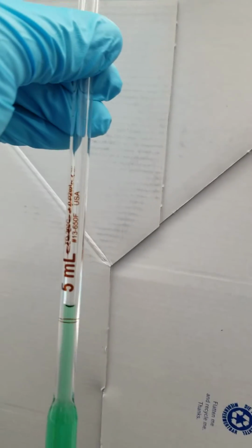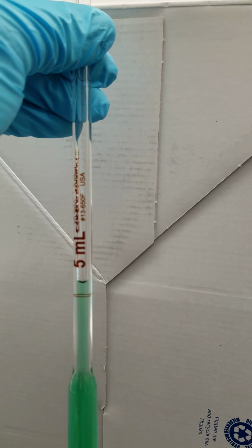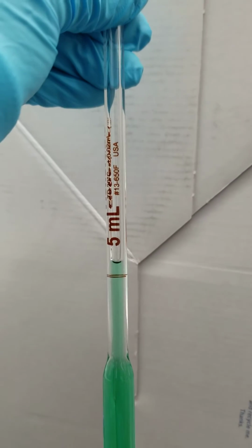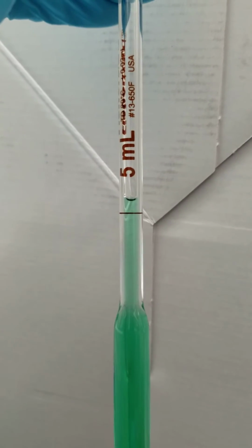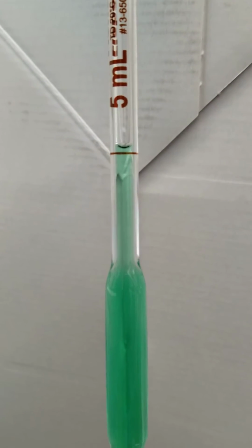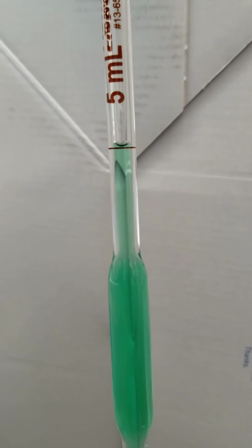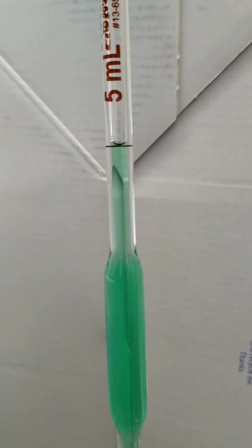So I'm adjusting my pointer finger and I'm allowing the pressure to lessen and I'm allowing the meniscus to go down. The meniscus is the bottom of the little dip. So now it's on the line.